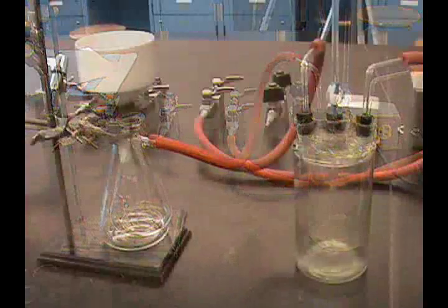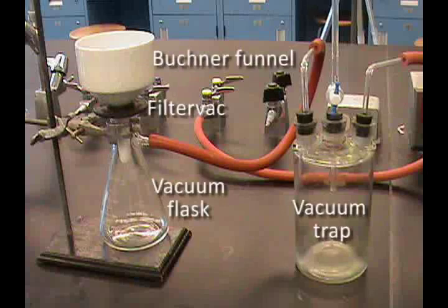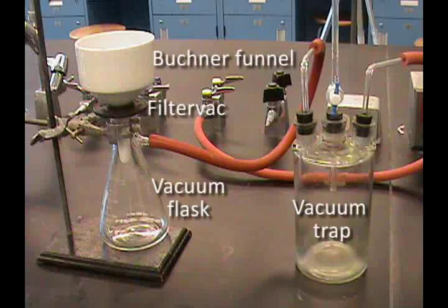A suction flask, trap, filter vac, stopcock, and vacuum source are needed in order to carry out the filtration.